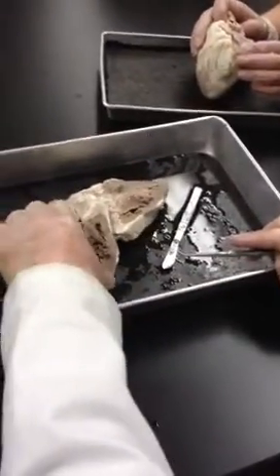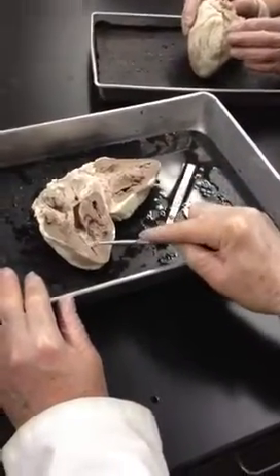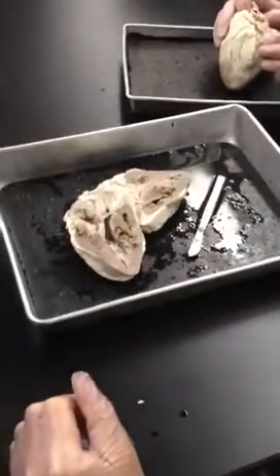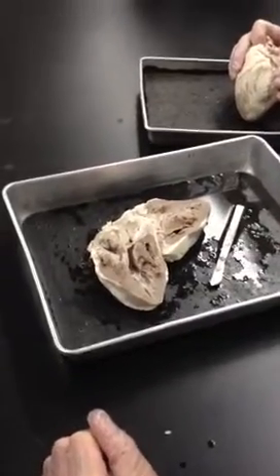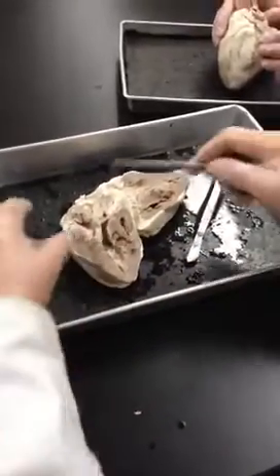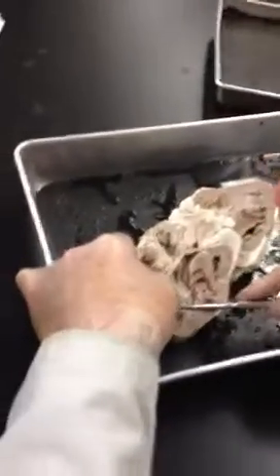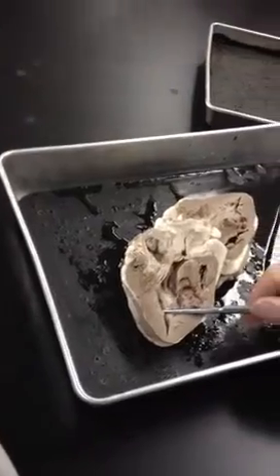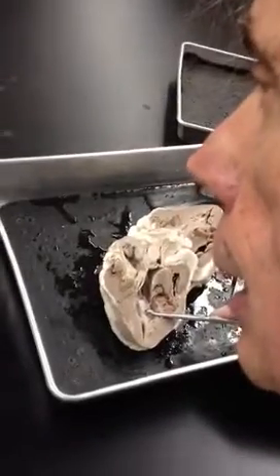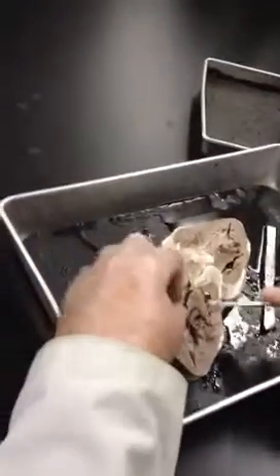This thick layer is the ventricular myocardium. The moderator band ensures you don't contract too hard — you do want to contract hard enough to pump about 70 milliliters of blood from the left ventricle, but not so hard that you damage the tissue. The moderator band is always controlling that. It's somewhere right here in the picture. The trabeculae carneae is what I was talking about over here.